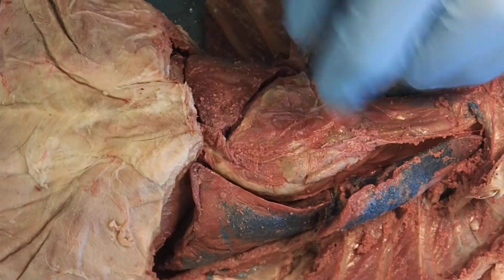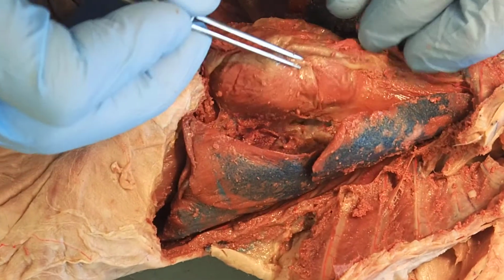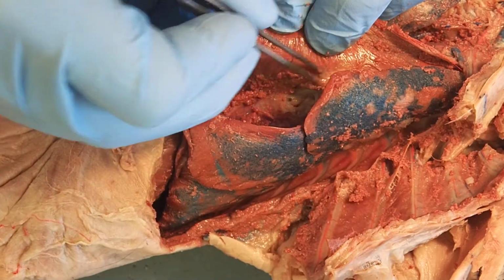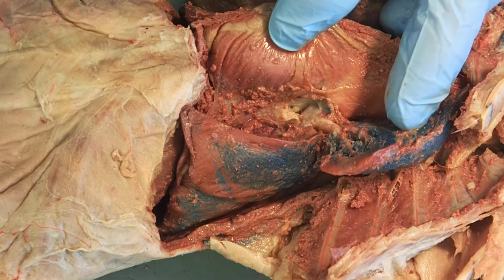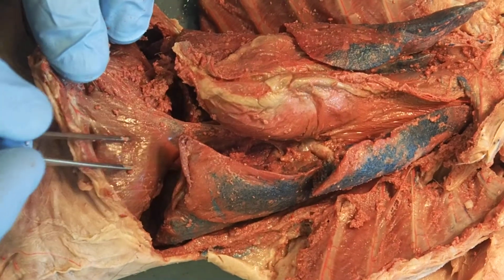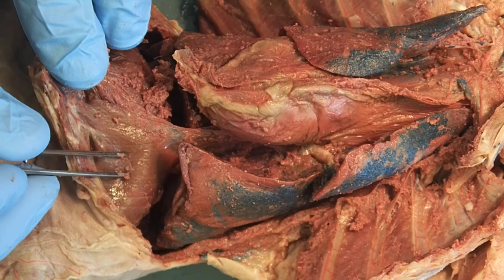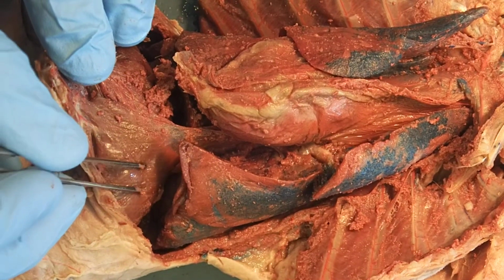One last thing while we're in here, if we did look on the bottom of the heart here, I might have to pick for it. Right here you can see there's a line. That's going to be the phrenic nerve. The phrenic nerve is going to go to the bottom here. You can see I have this muscle-like structure separating the thoracic cavity and the abdominal cavity. This is the diaphragm, and the phrenic nerve is what's ultimately innervating the diaphragm.